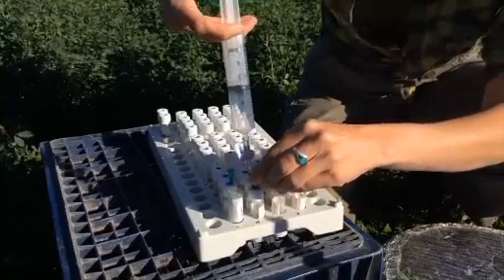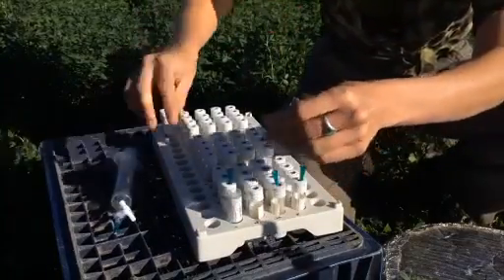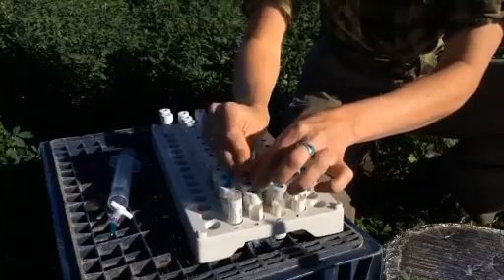Remove the needle from the chamber septum. Transfer the sample to a collection vial. Continue to move through chambers until all samples have been collected.